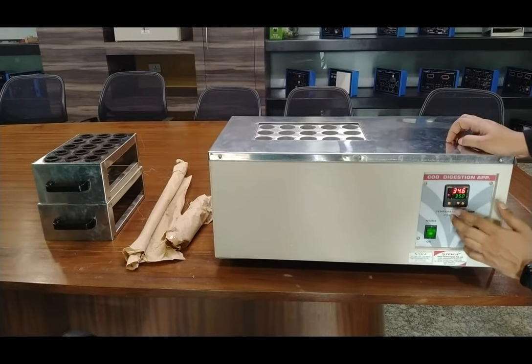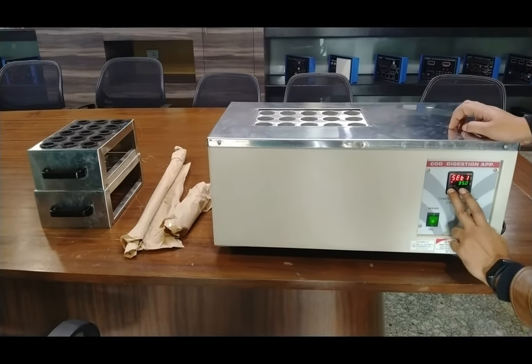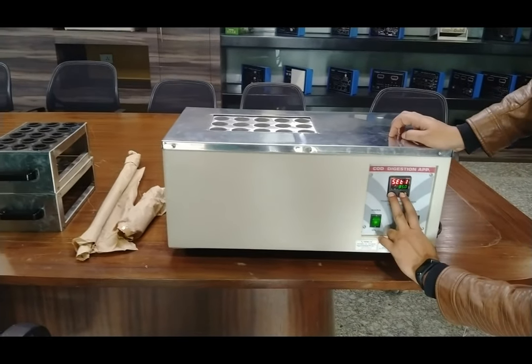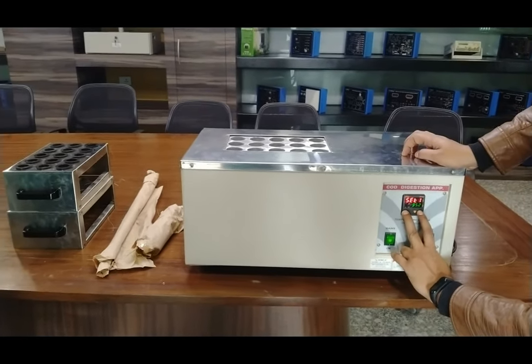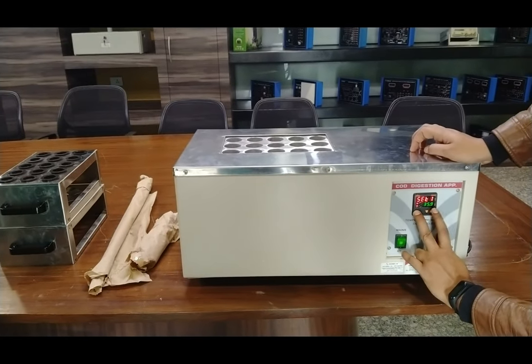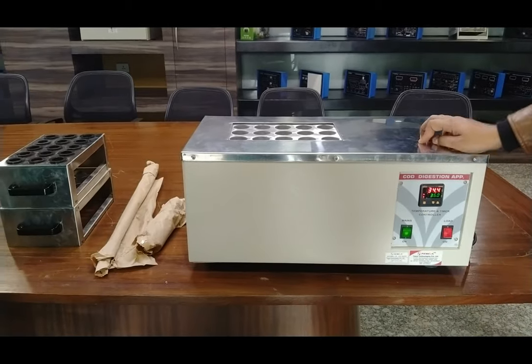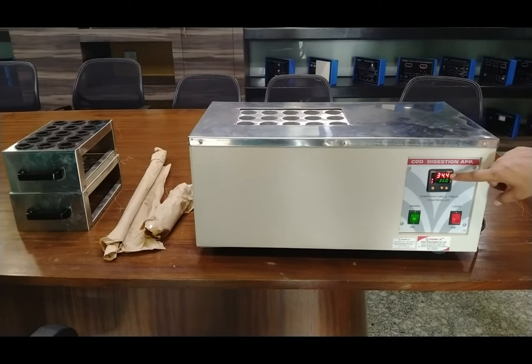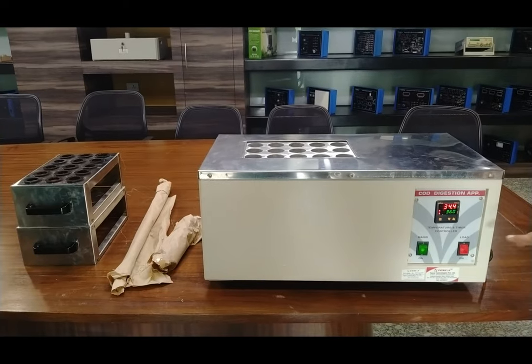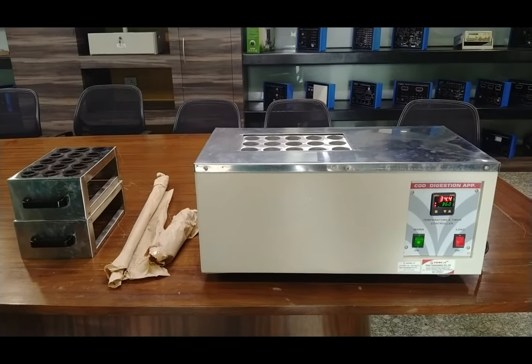To set the temperature, press this switch along with the up and down keys to increase or decrease the temperature. Here I am setting the temperature at 36 degrees Celsius. When the temperature reaches 36 degrees Celsius, the PID temperature controller will automatically vary and maintain the temperature at 36 degrees Celsius.